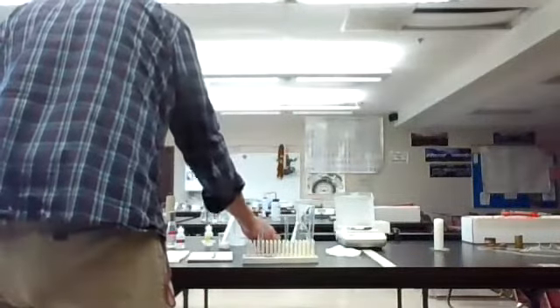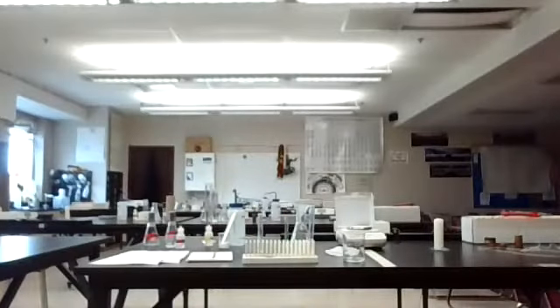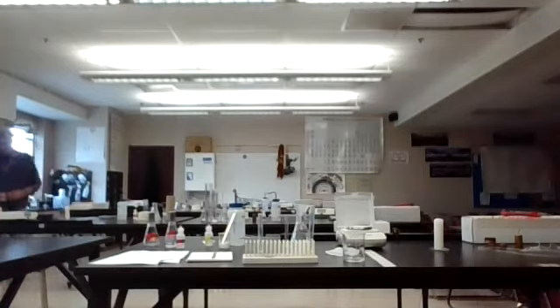Now we're just going to drop the penny in, and I'm going to swirl this up. I probably should have shown you what the penny looked like before. Let me grab another penny. I think we have enough in there to do it twice.